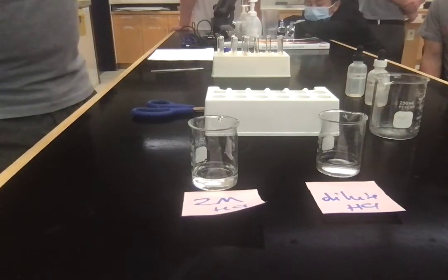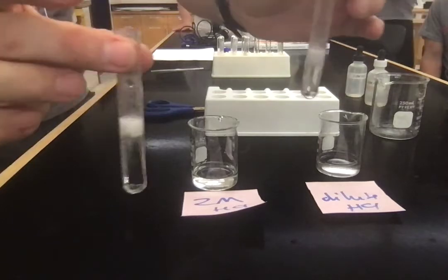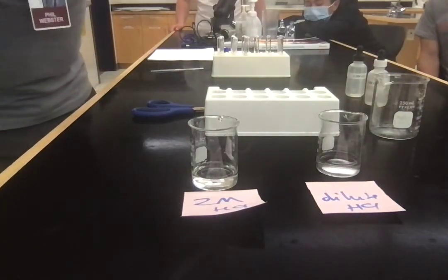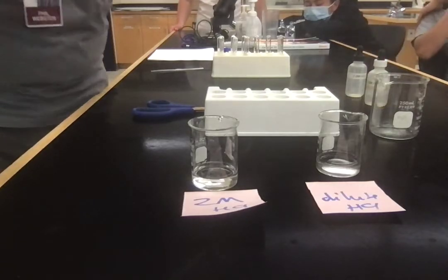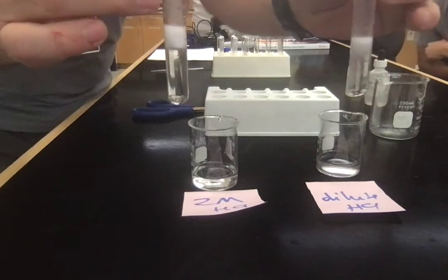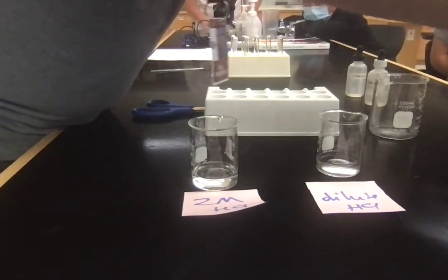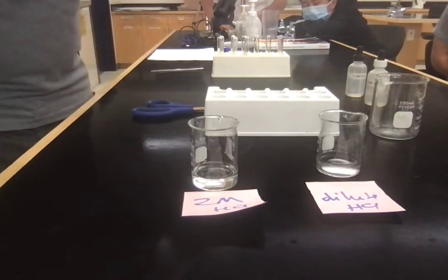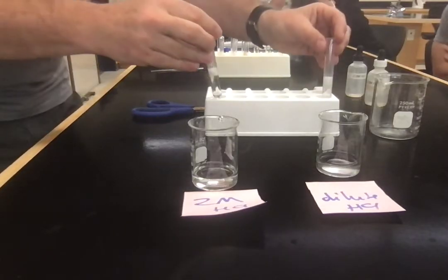Is there any other visible observation that we can see? Yeah, there's a lot of condensation on this one. Well, there's less liquid in the other. I wouldn't trust the less liquid thing because I didn't measure it. But in comparison, that one's barely above room temperature and that one's really, really hot. This is the same as it was on the previous one. So this is our concentration.